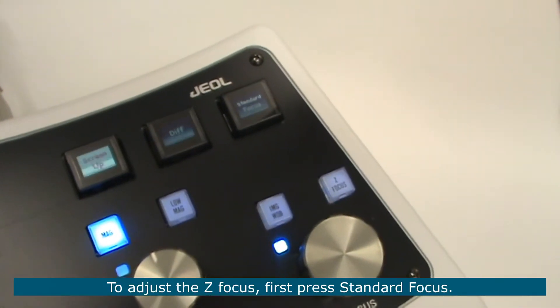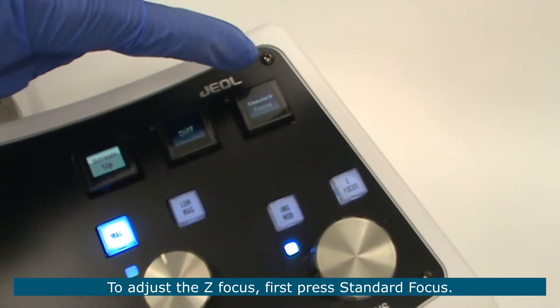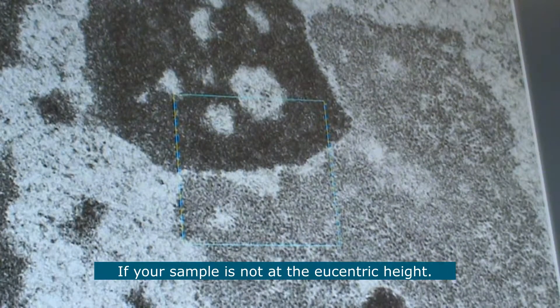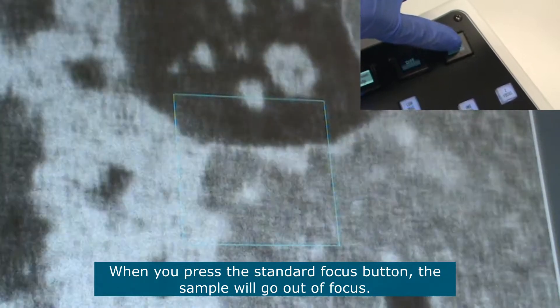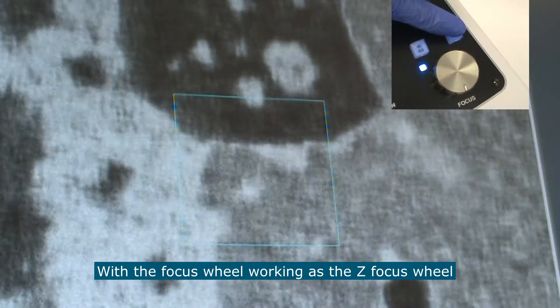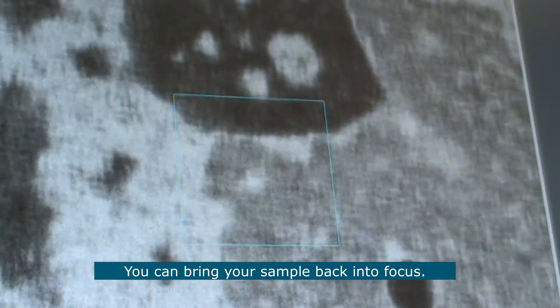To adjust the z-focus, first click on standard focus and then select z-focus. If your sample is not at eucentric height, when you press the standard focus button, your sample will go out of focus. So with the focus wheel now working as the z-focus wheel, you can bring your sample back into focus.